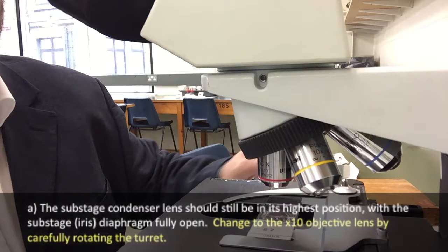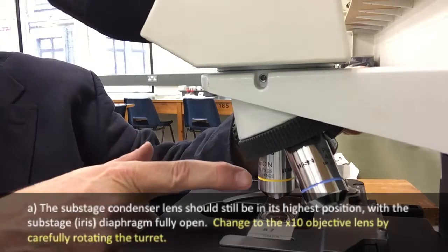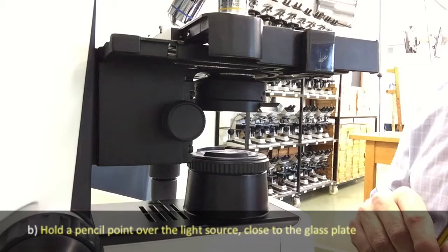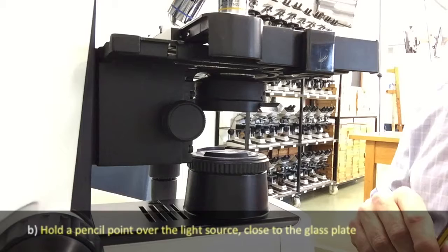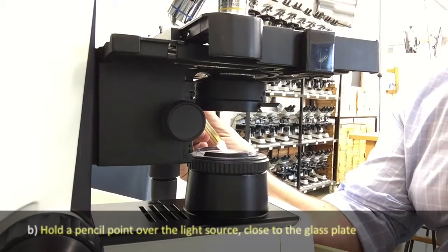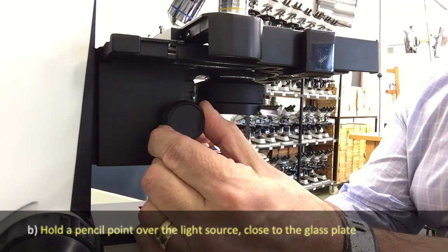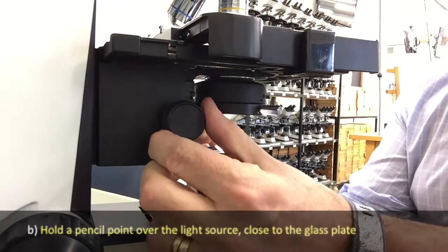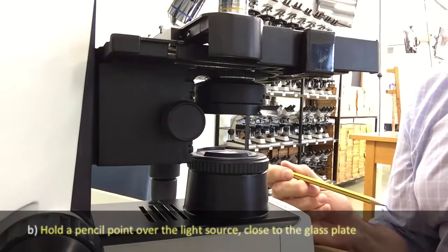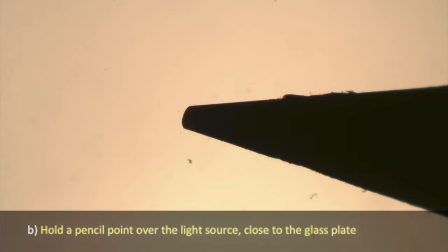Now switch to the 10x objective lens — it's the one with the yellow band, up from the four times that we were using before. Refocus the specimen if necessary using the fine focus control, then hold a pencil point over the light source close to the glass plate and move the condenser lens away from the stage downwards using the single ridged wheel located below the stage, until the pencil point is sharply in focus.